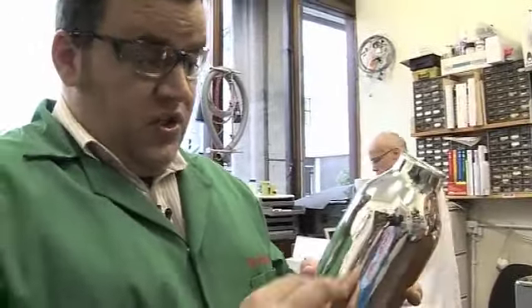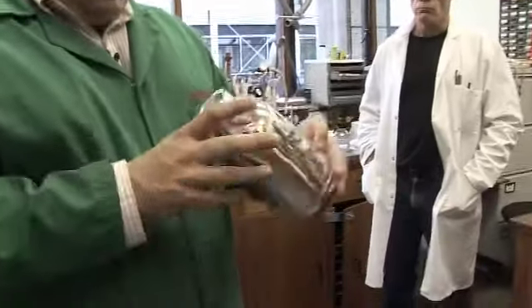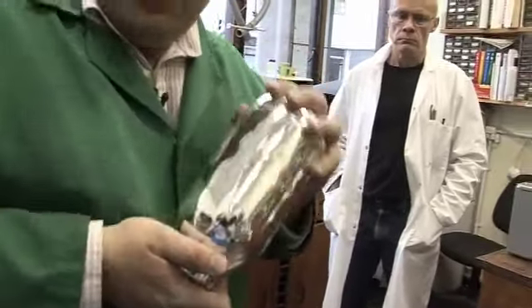And we also silver the inside of that glass to make it look nice and pretty, such that any heat that is in there is bounced back in, reflected back in. So we thought we'd show you how we'd silver some glass because that's pretty cool chemistry of silver.